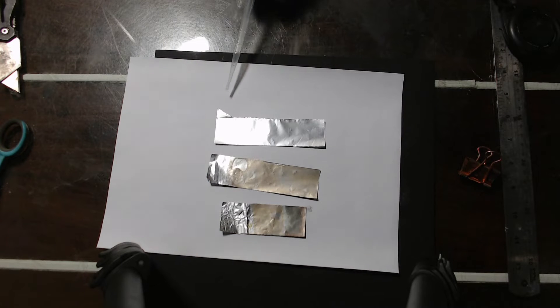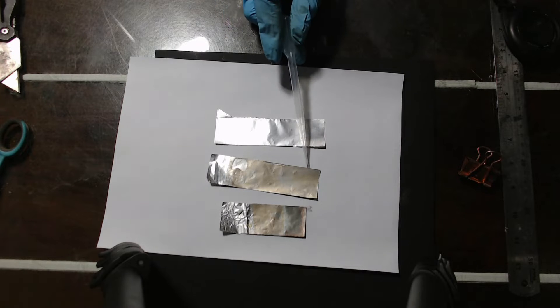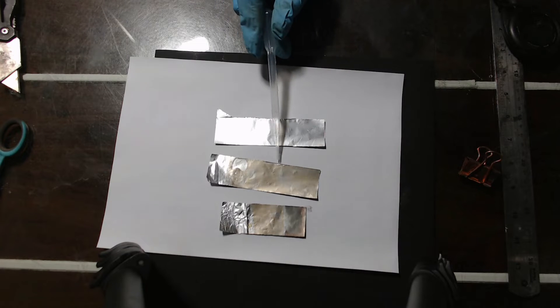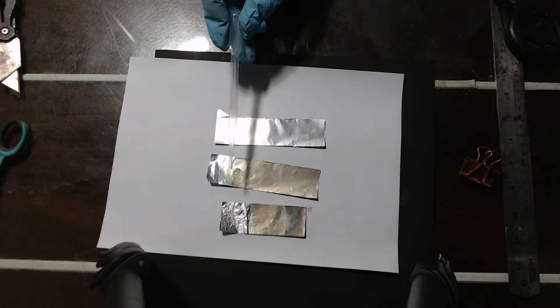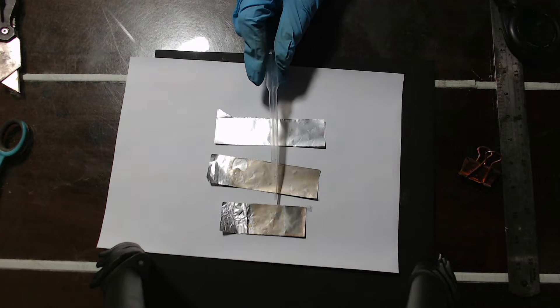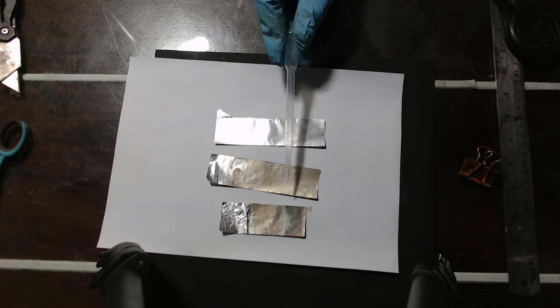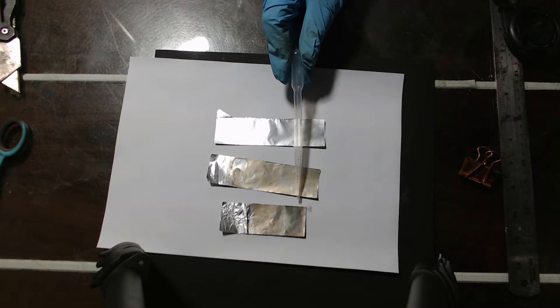Here you can see the bare aluminium, and here you can see the golden colour that is the conversion coating, and here's the aluminium tab where I connected it. And here you can see the aluminium — that bit's the golden colour of the conversion coating. Here's the really cool bit: that bit there is copper plated.